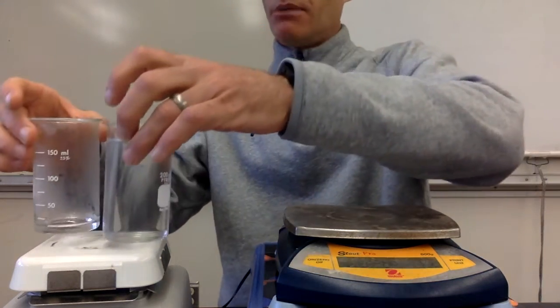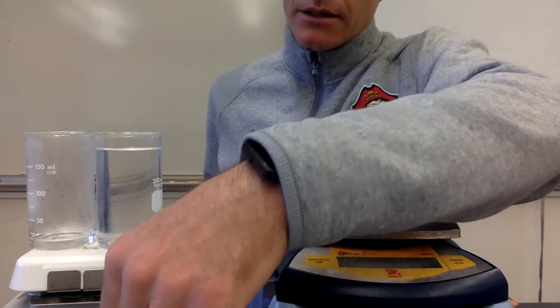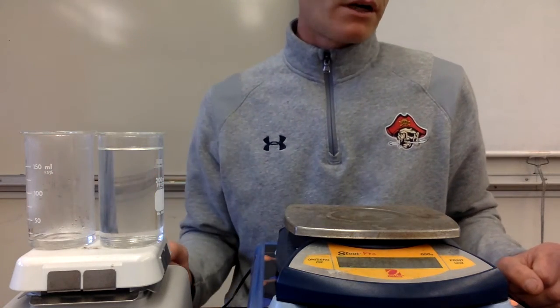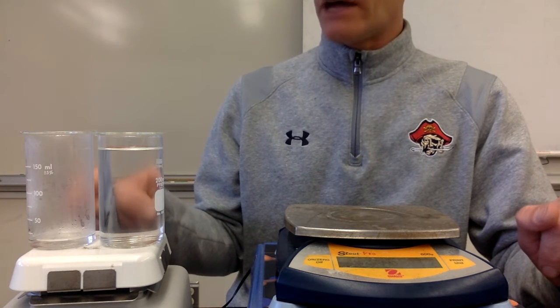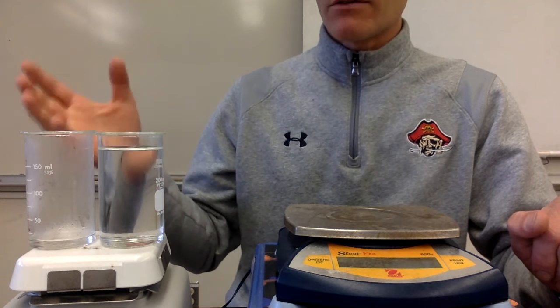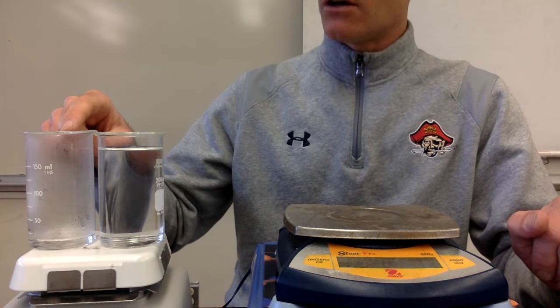So what I'm going to do is put these both on the hot plate. I'm going to turn the hot plate all the way up, and we're going to see how much energy it takes to evaporate this water that's already at the boiling point. This water should start boiling pretty soon because it's at or near the boiling point. And we're going to see how much energy it takes to turn all of that to vapor. We're going to stop when this one completely gets used up, when it's completely all turned to vapor.